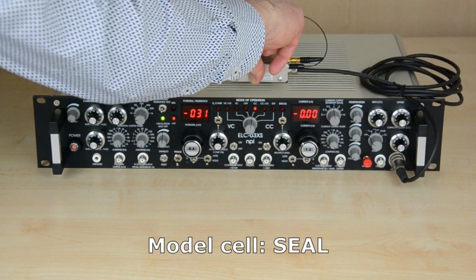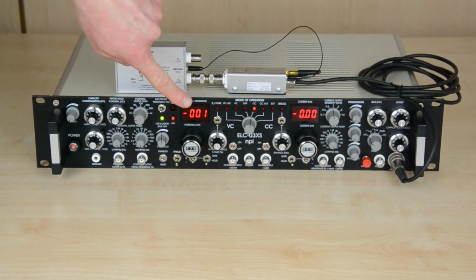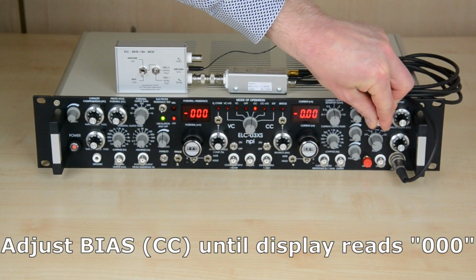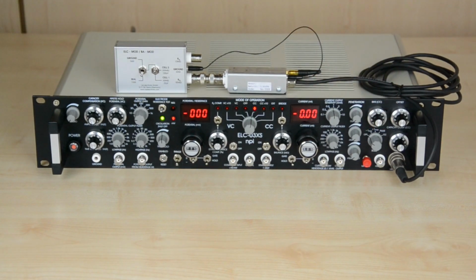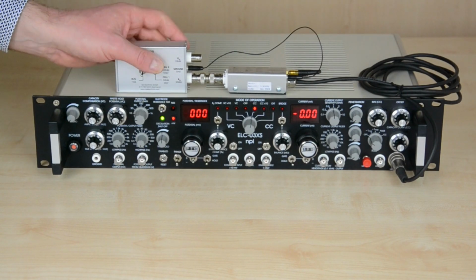Put the model cell in seal mode. If the potential display shows any voltage deflection, this is caused by an unbalanced bias current. Adjust the bias potentiometer until the display reads 0. When everything is set correctly, the display should remain at 0 while switching between different resistances in the model cell.